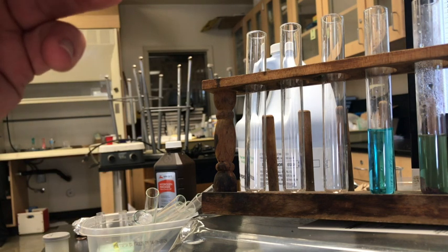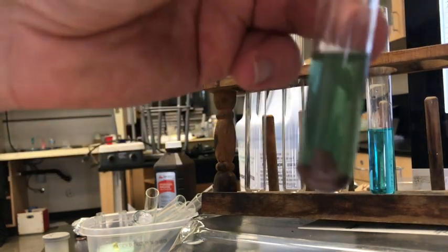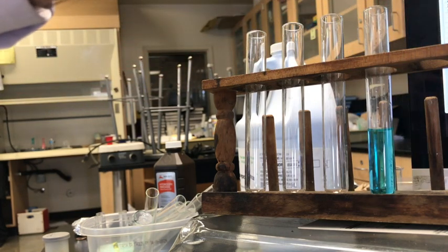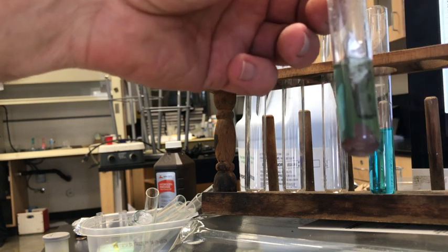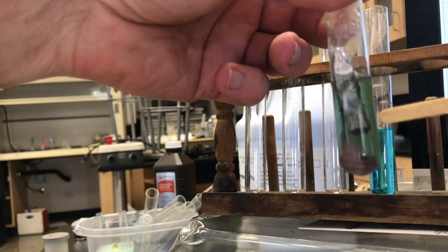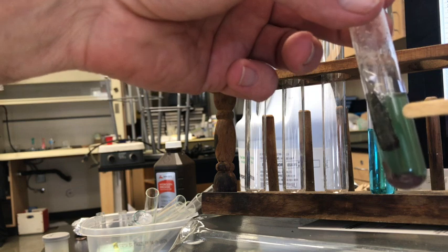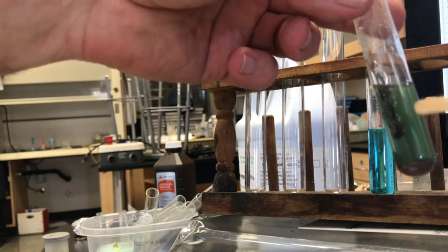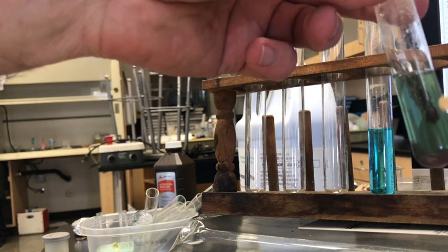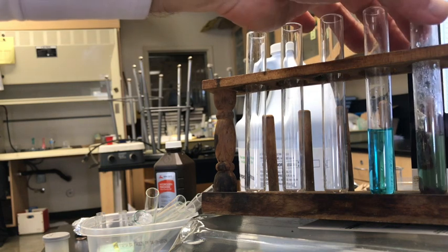So here's a little bit of aluminum, and we'll push that down. And you can see, let's bring that into view. You can see I still must have a little copper chloride in there because look, I got some more brown happening around the edges, and so some more reaction. Now the bubbles do not represent boiling. It's not getting that hot. The bubbles represent a secondary reaction that's happening to create bubbles.